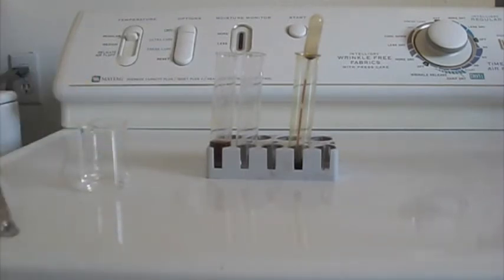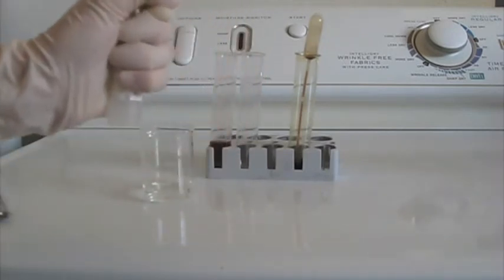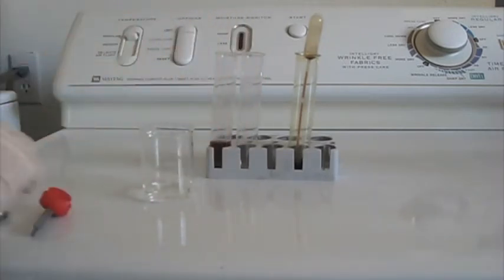Now make a solution of sodium thiosulfate. Simply place some sodium thiosulfate in a beaker and add a little bit of water, or just put a little bit of water in the beaker, and stir until it dissolves.